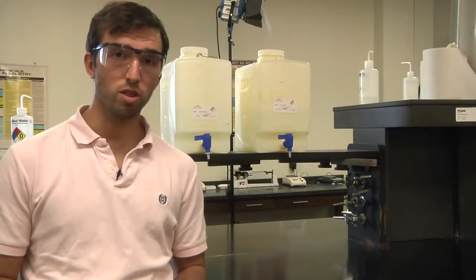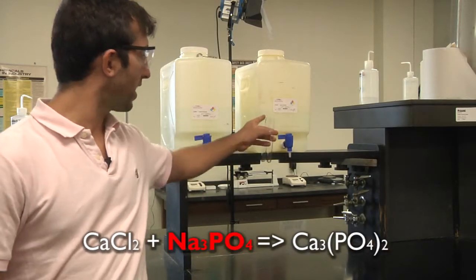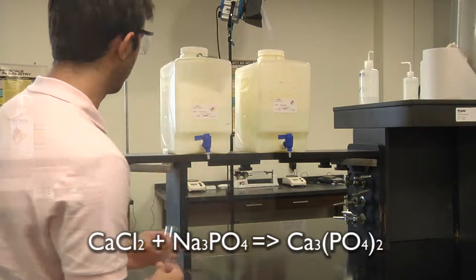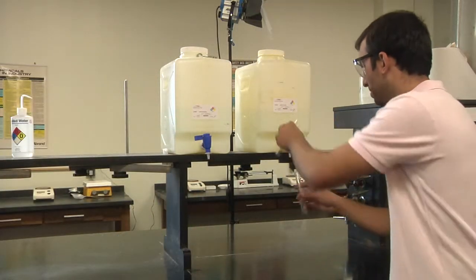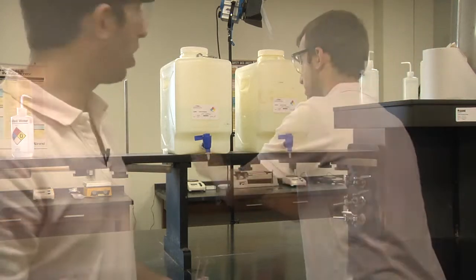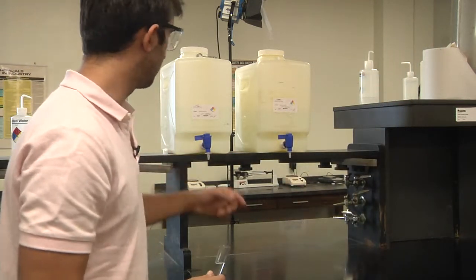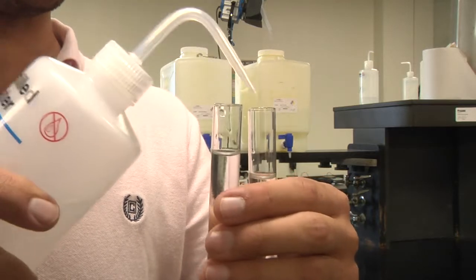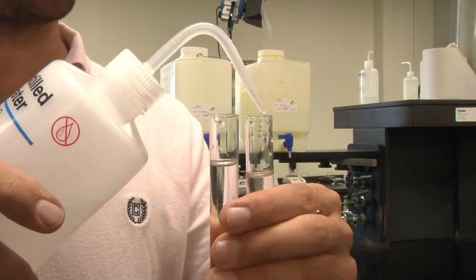I will assign your lab group the quantity of sodium phosphate and calcium chloride that you will get. To dispense the quantity, you can do that right here. All you have to do is turn the knob. Make sure you get all your chemical by dispensing a little bit of water down the side of the test tube.